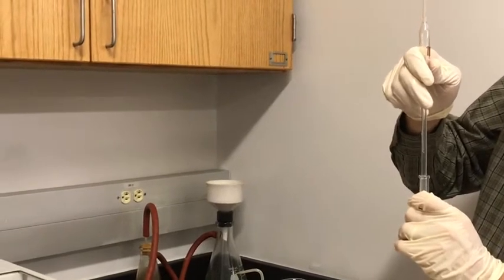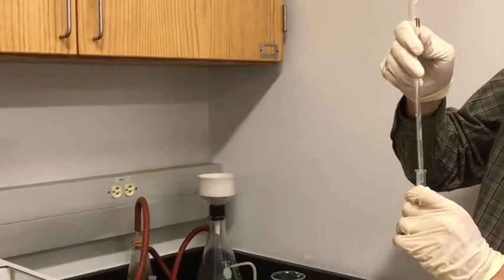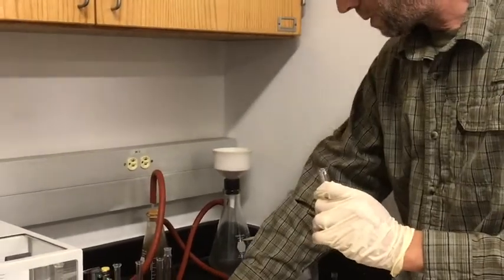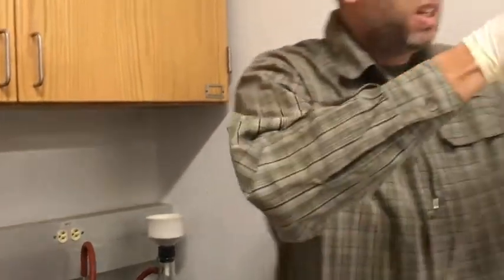So we should expect transmission to keep increasing.